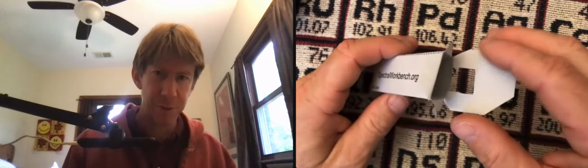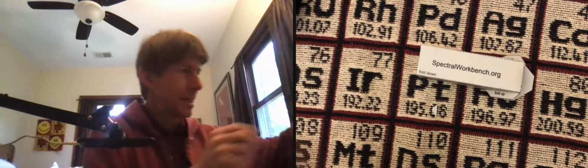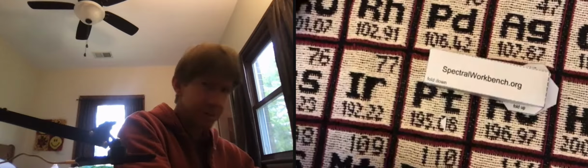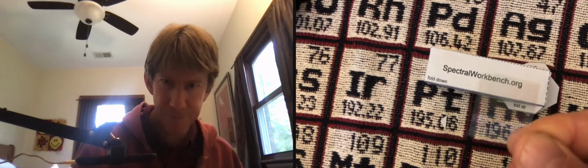Now, before I close this up, I have to go get my diffraction grating. Your diffraction grating is going to be in your Chem 300 lab kit in the Ziploc bag with the magnesium. If you look in there for a very tiny piece of plastic, oh yep, there it is. And it will look just like a little tiny piece of plastic.